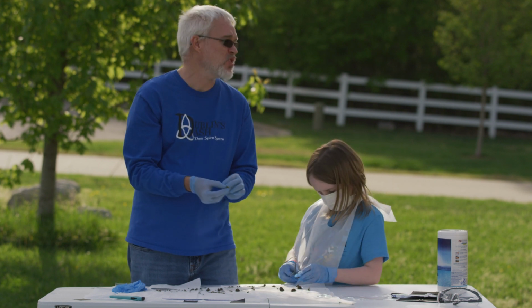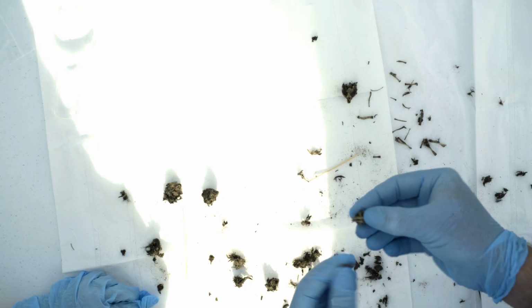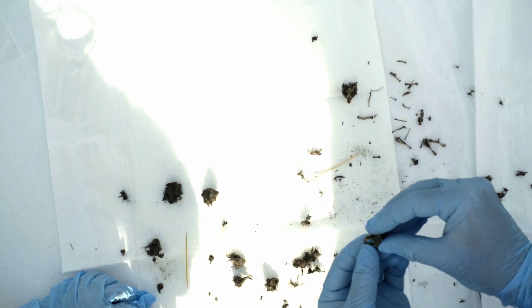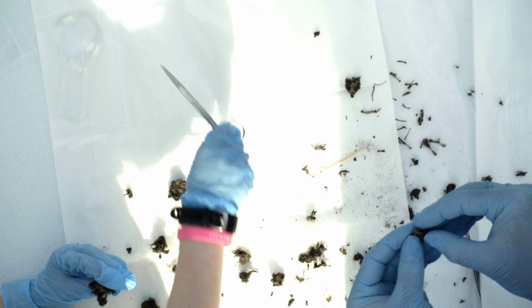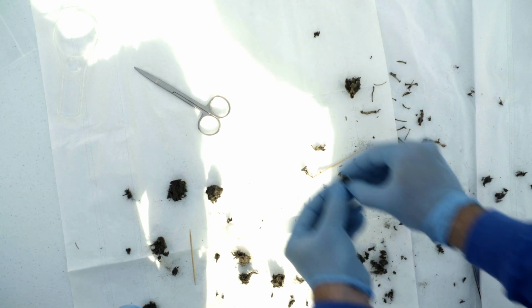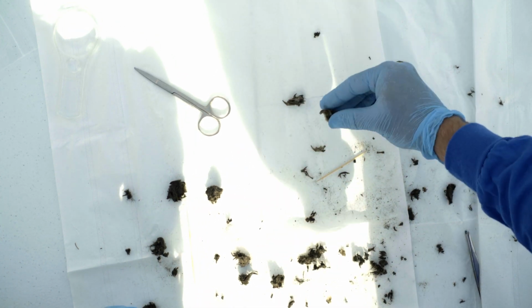And the majority of their actual teeth look a lot more like molars than they do any other kind of sharp teeth. So most likely these were, now that I pay more attention to the teeth, these very well could have been primary consumers, which could have been herbivores, including this one.